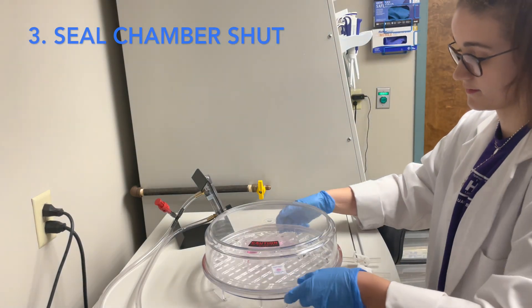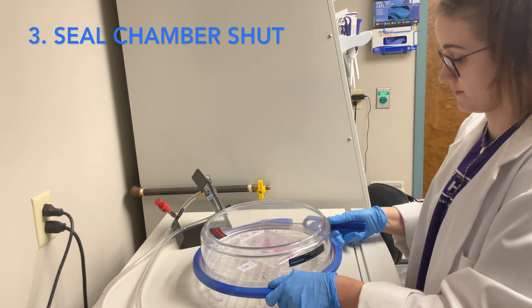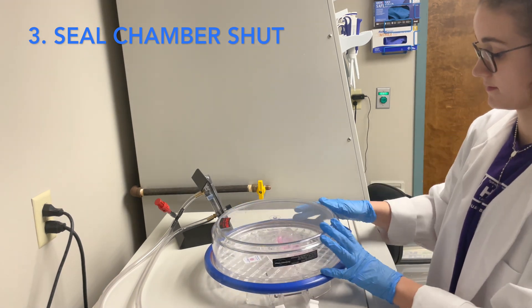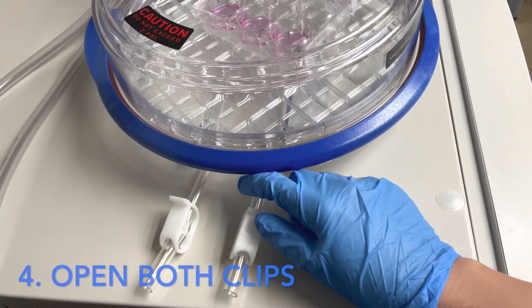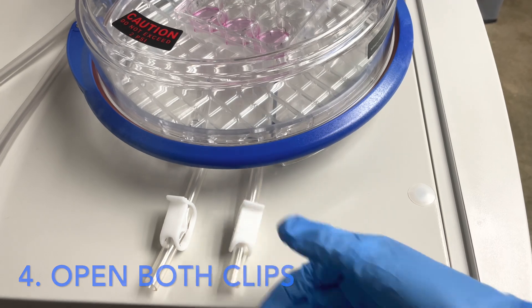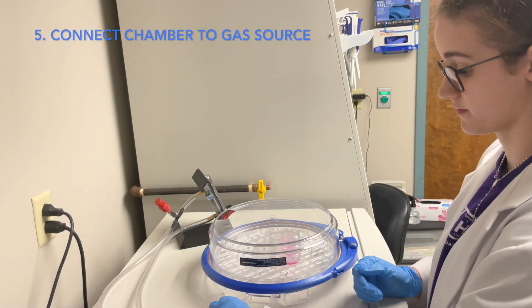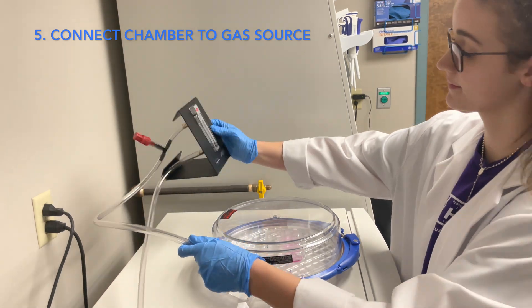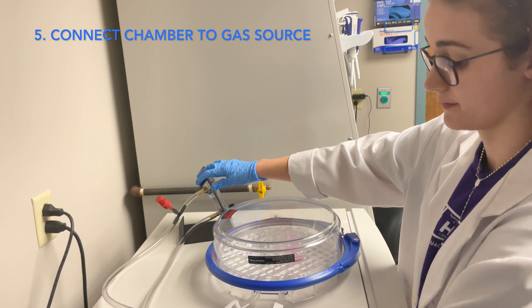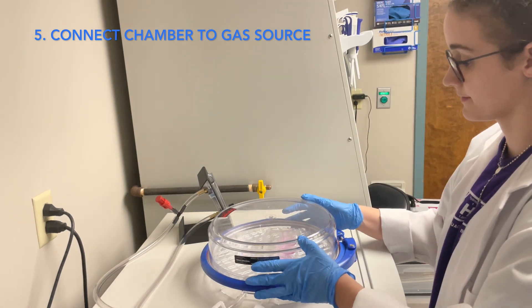As I place the lid on top of the hypoxia chamber, I'm checking to make sure everything sits correctly — if it is sitting incorrectly, the seal may not form properly. I open the O-ring, place it around the hypoxia chamber, and push the lever on the side in to snap it shut and secure it. Again, I'm checking to make sure everything looks placed on correctly. There are two tubes coming out of the side of the hypoxia chamber with white clips. Open these clips by pushing back on them, or close them by pushing down to secure them. Now that I have my cells in the hypoxia chamber and the lid is securely shut, I am going to connect one of the tubes to a gas source. Both my clips are open so gas can flow freely through the chamber.